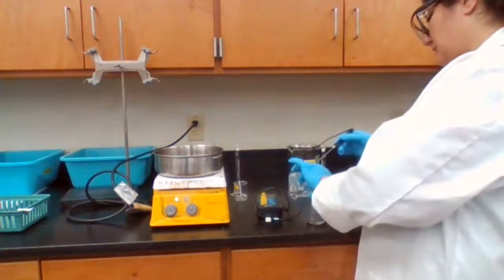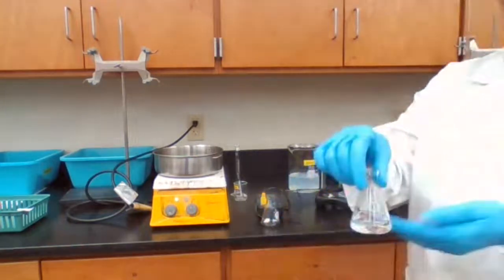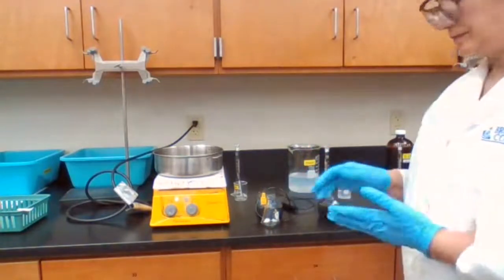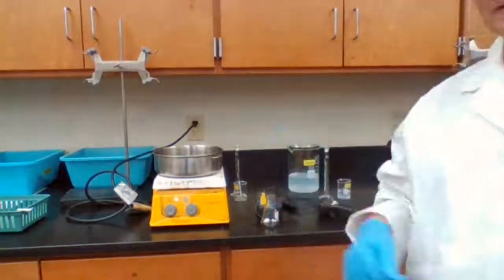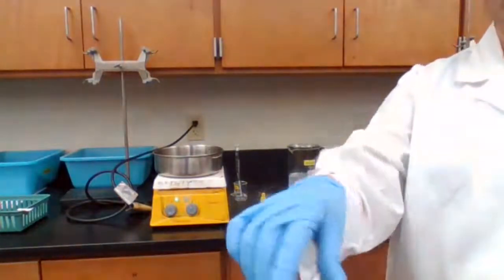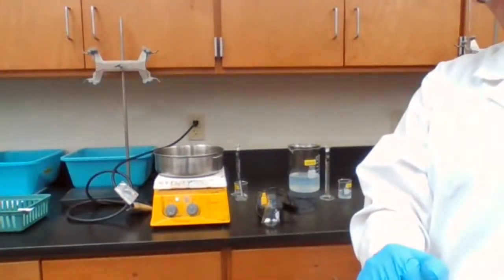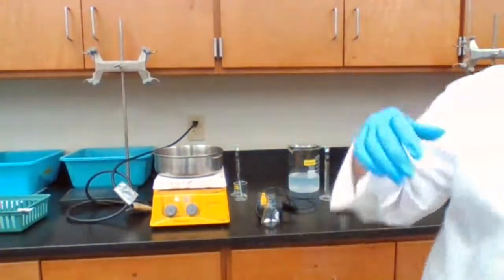Okay. The temperature went below 44, so I had to put it back in to make it 44. It went to 44.8 actually. Okay, 36. 37.